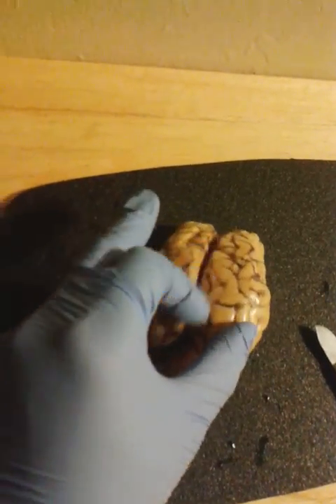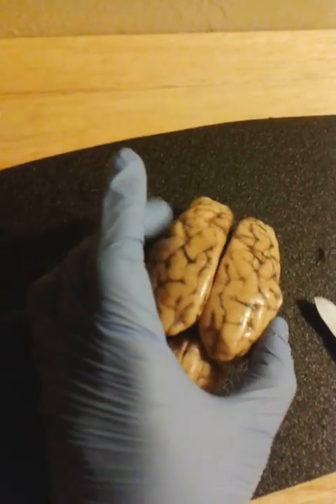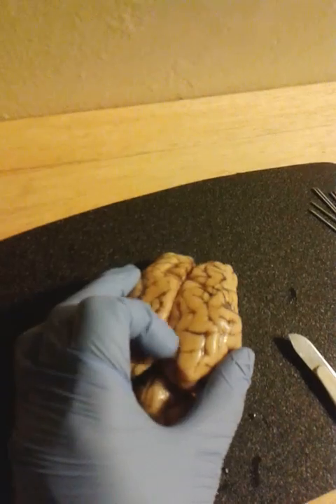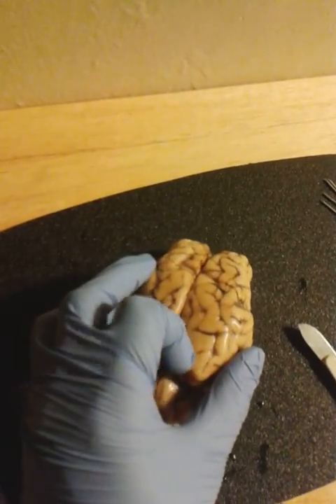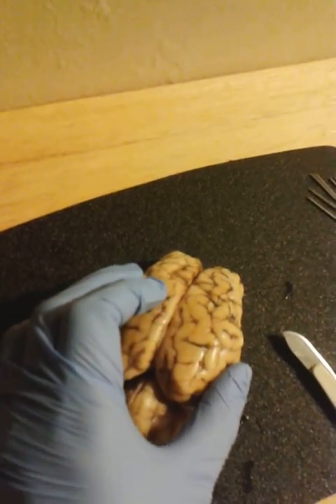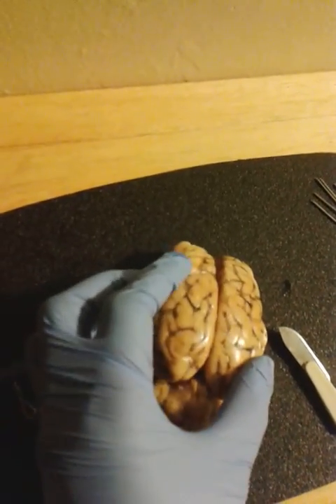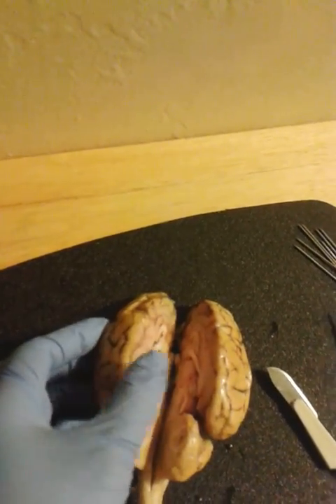This line down the center where I dissected along, even without it being dissected, if it had still been closed, would be defined as the longitudinal fissure. And this is the deepest groove, a very, very deep groove, deeper than the sulcus, as you could see even before it was cut through. And then here we go, the right and left hemispheres. So that longitudinal fissure divides both the right and left hemispheres.